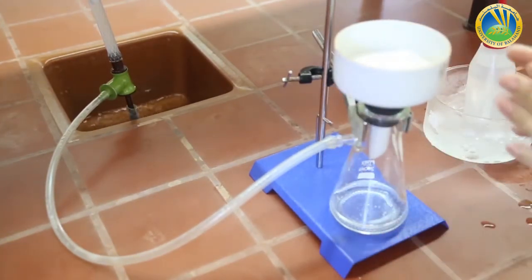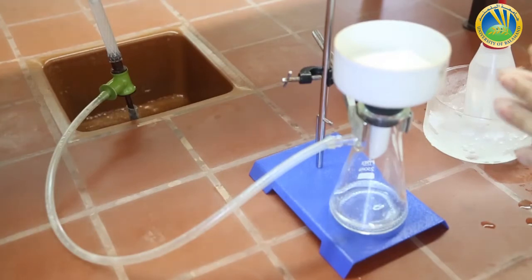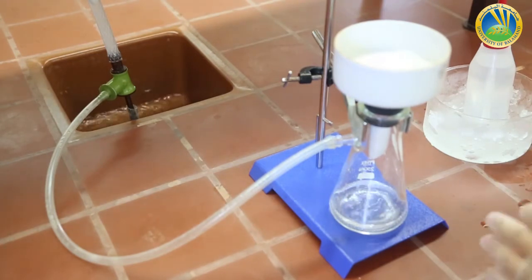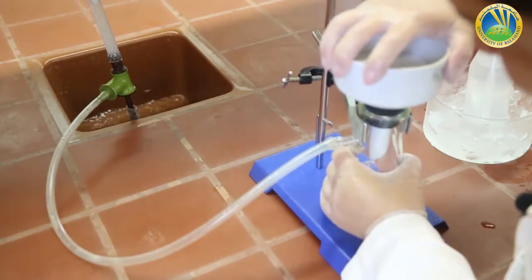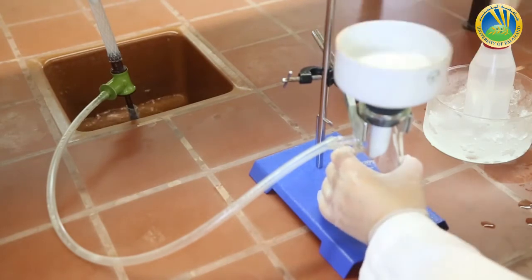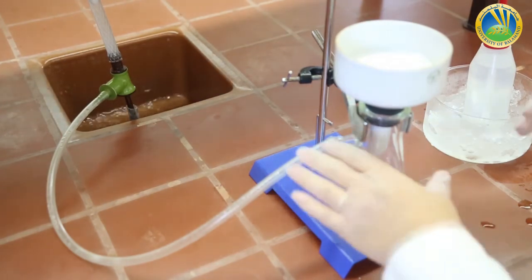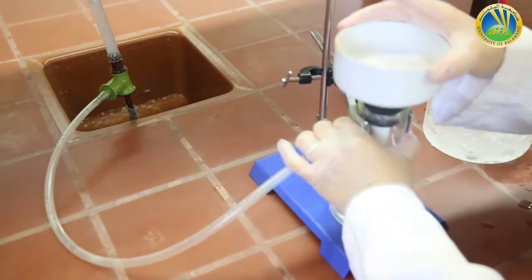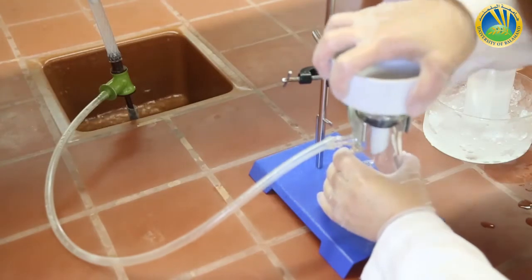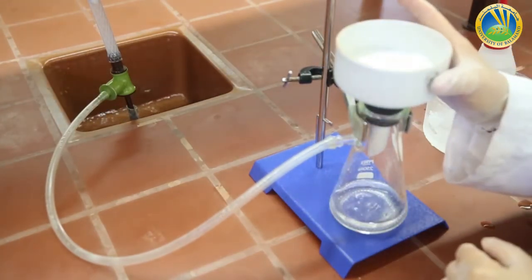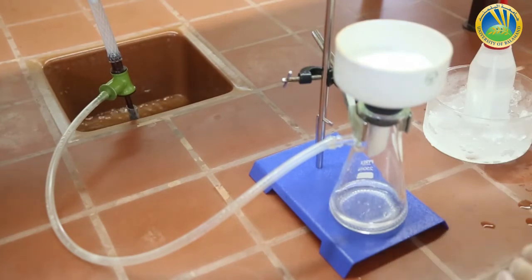Very nice shape of crystals. Are you able to see this nice shape of crystals inside the funnel of the Buchner? I think my filtration now is done because the crystals are almost dry.